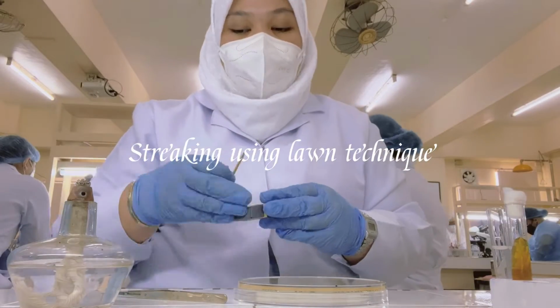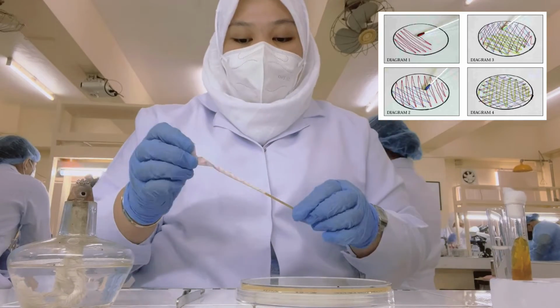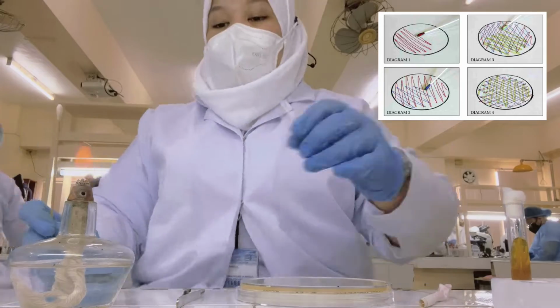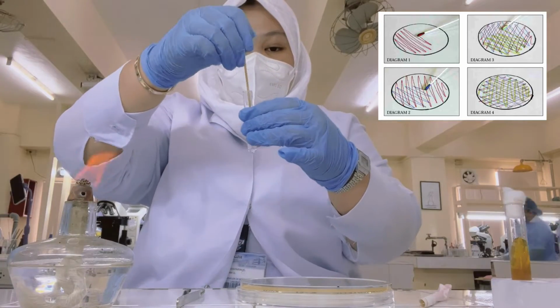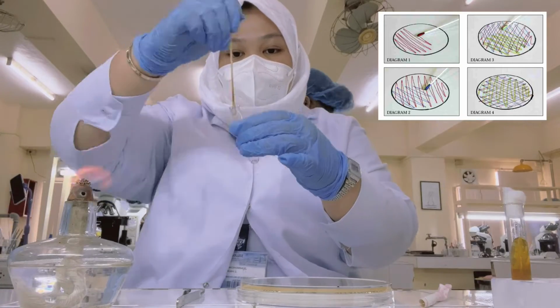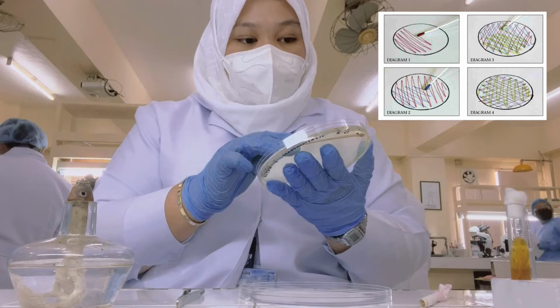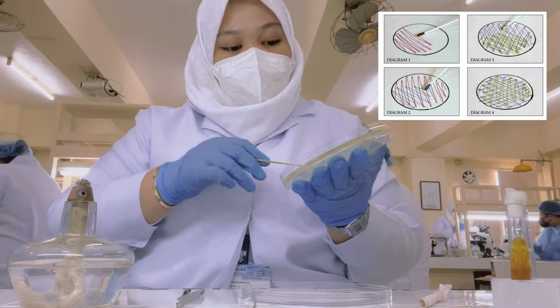Now you can do the streaking with the lawn technique. Using an autoclaved cotton swab, dip it into the suspension. Then streak in a horizontal motion. Always make sure every streak is close to one another.